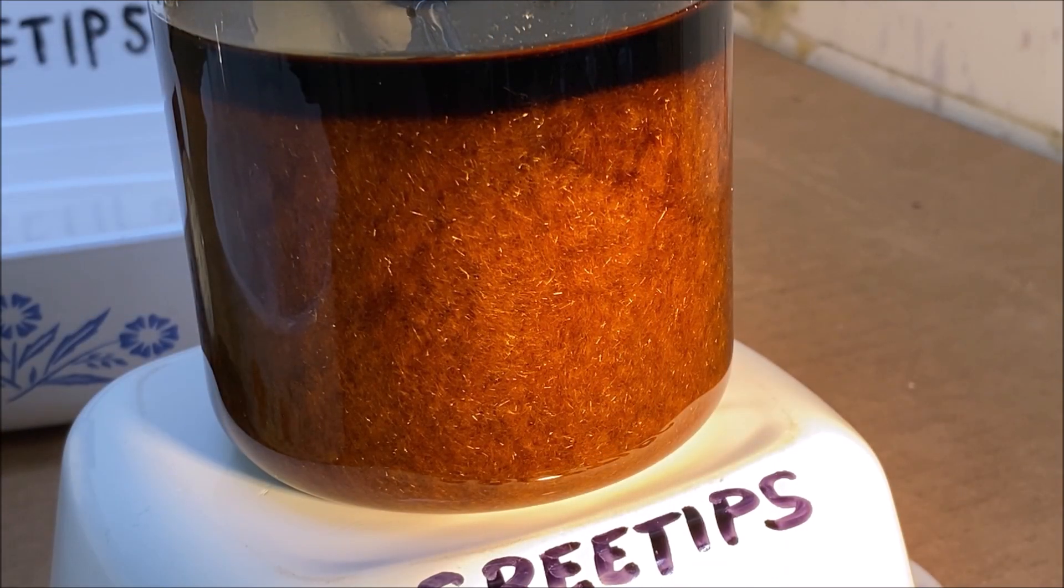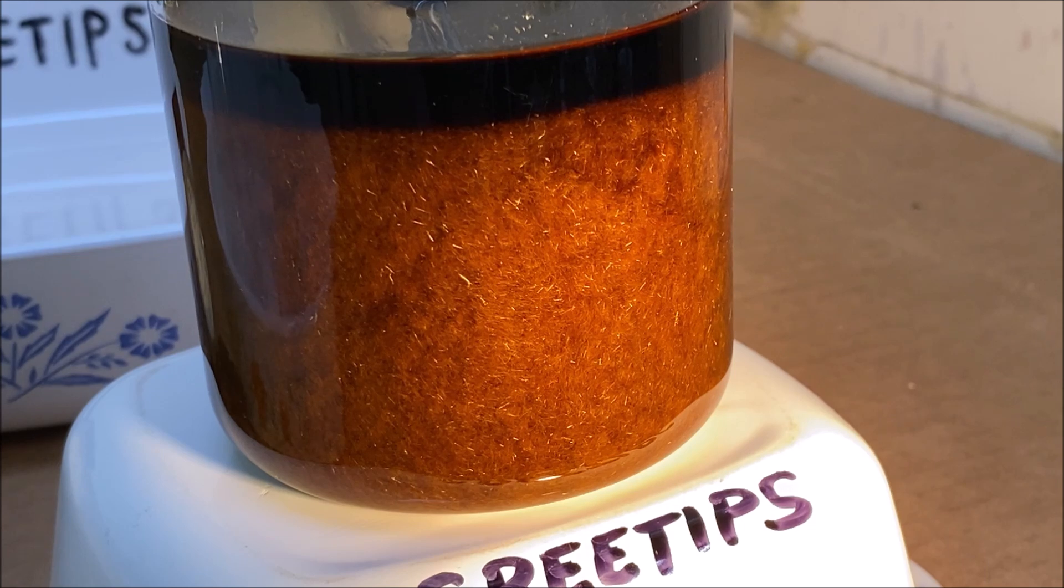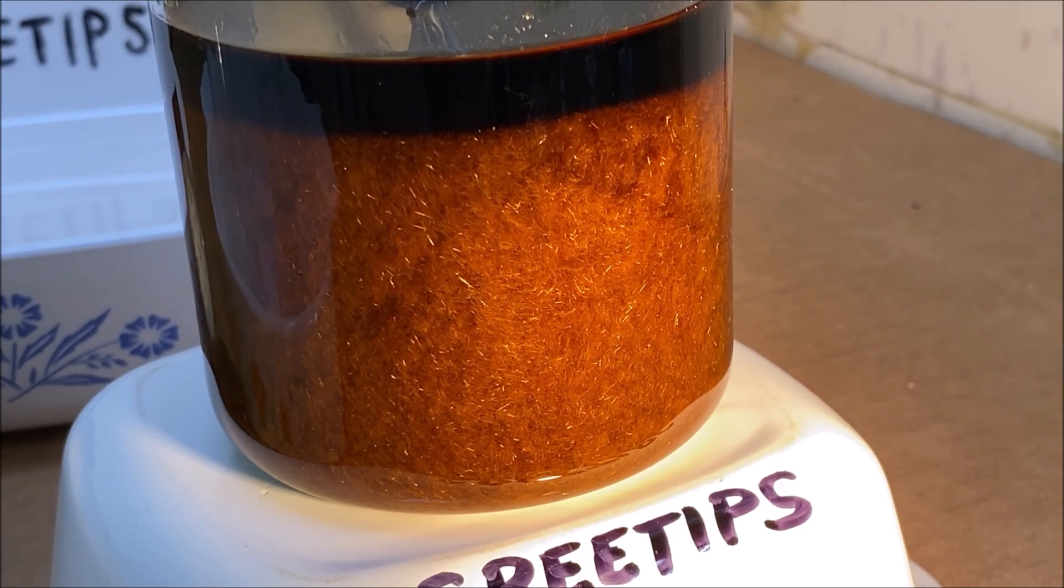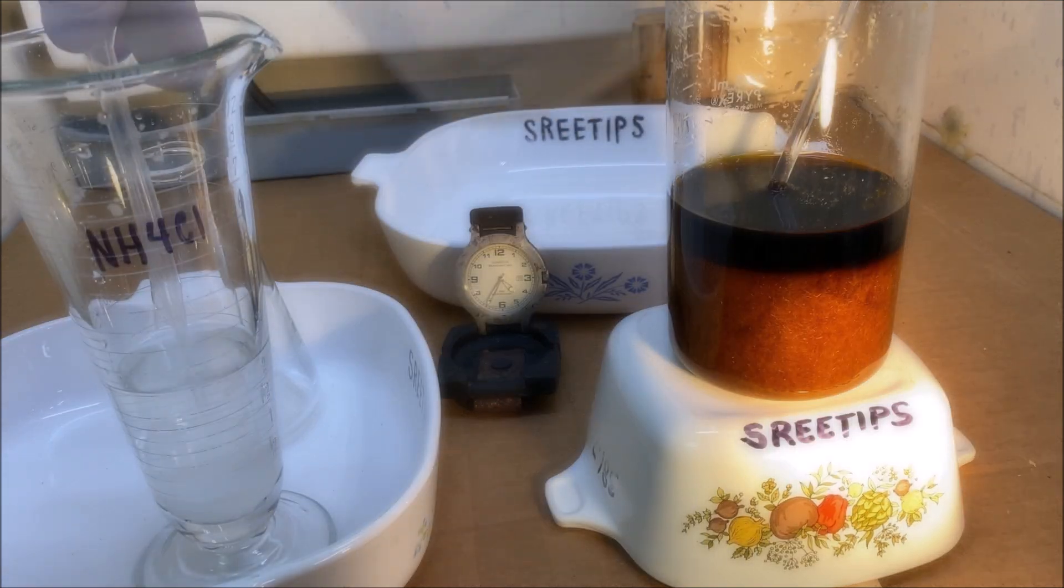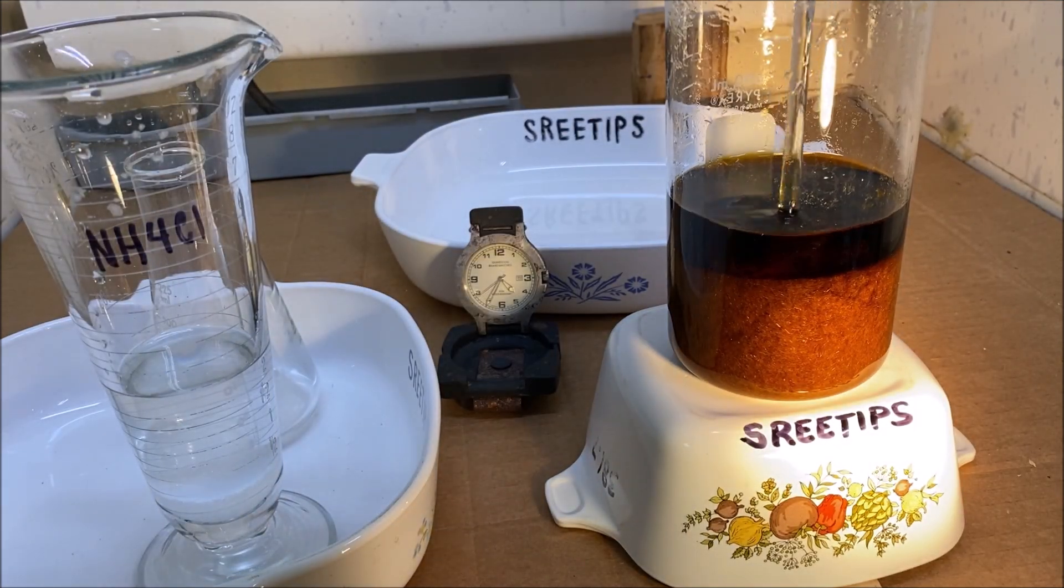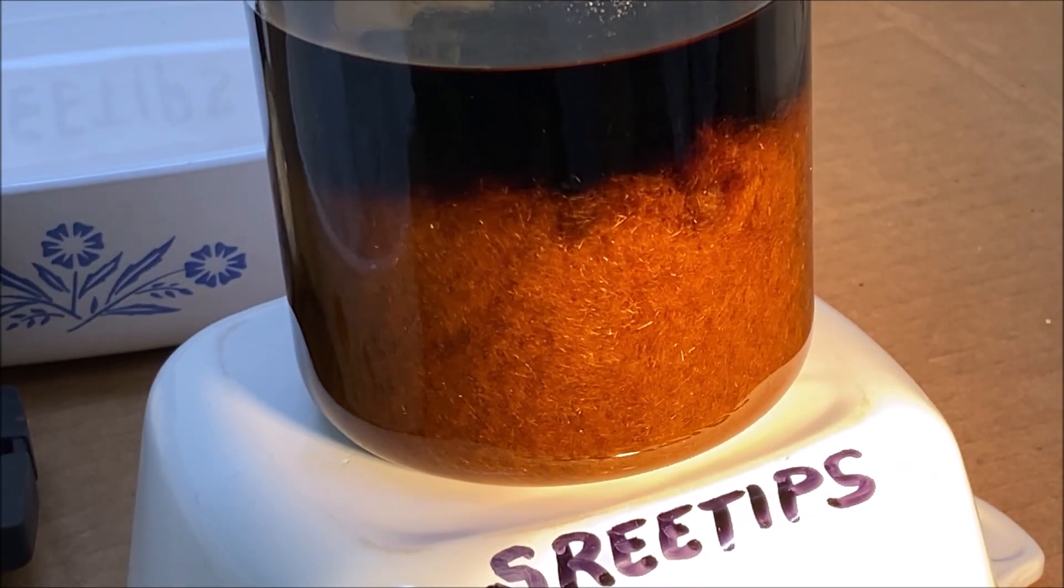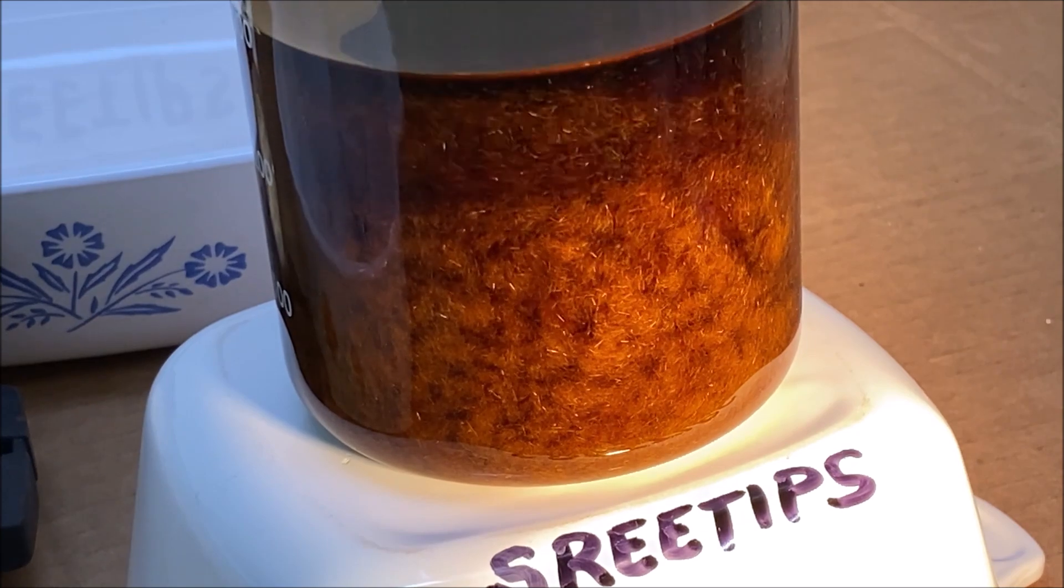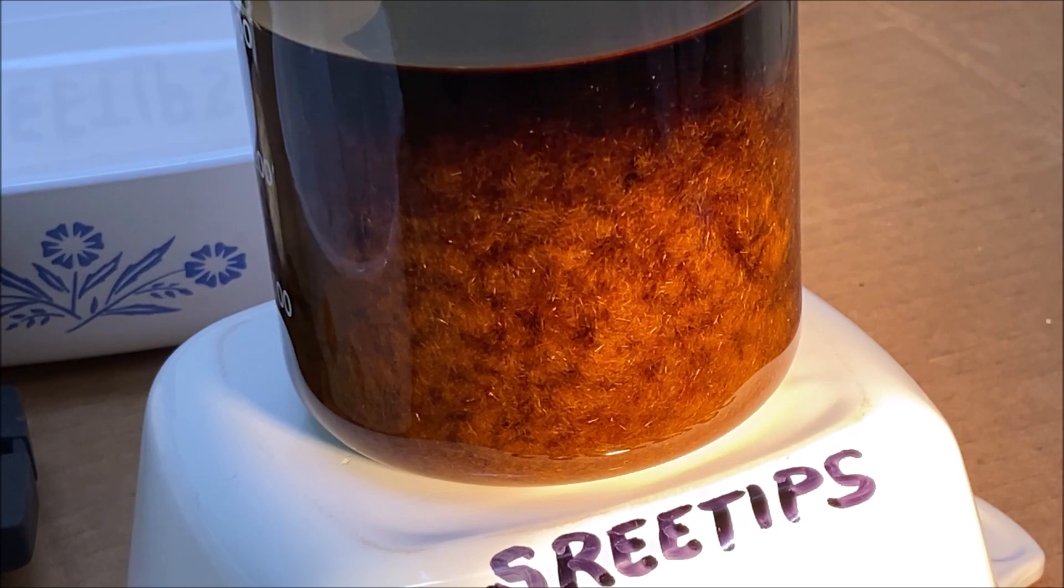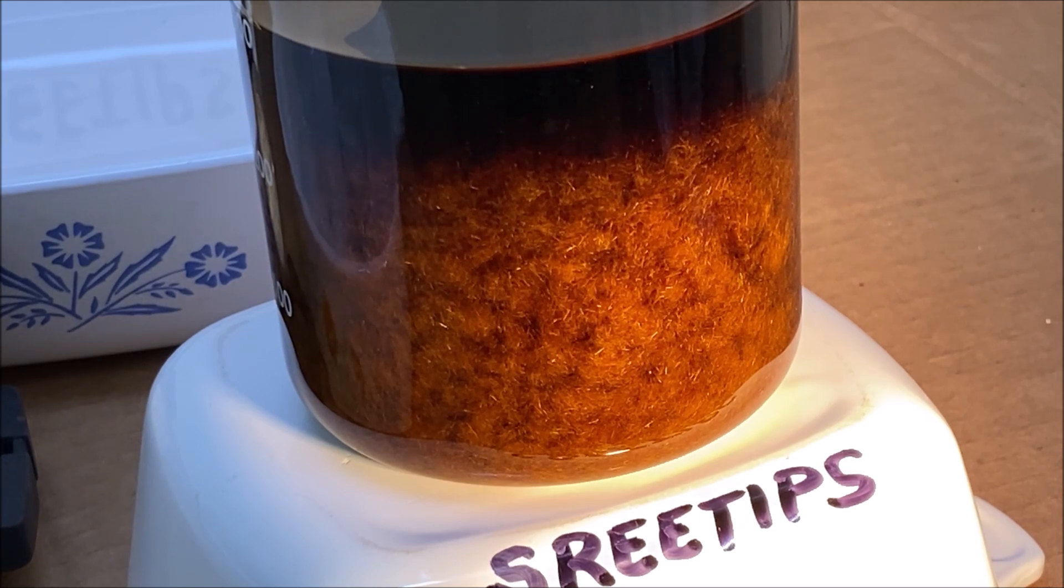Those crystals are not what we want. Here are kind of neat to look at, fine little needle-like crystals of some compound of platinum. I'm not sure what it is. This is not desirable, so now we got to back up and punt and figure out what we got to do next to get this corrected.